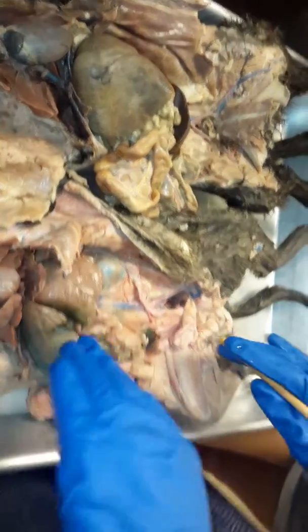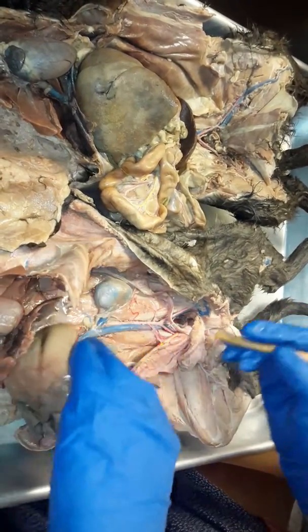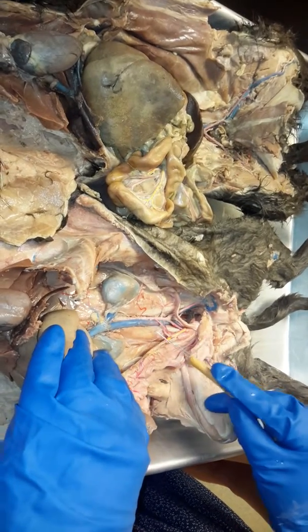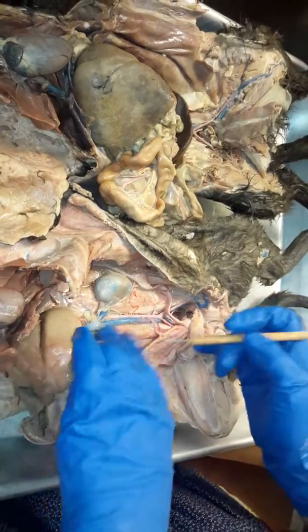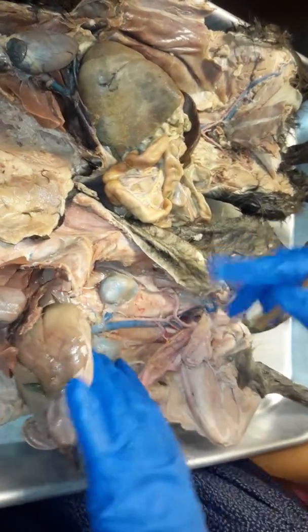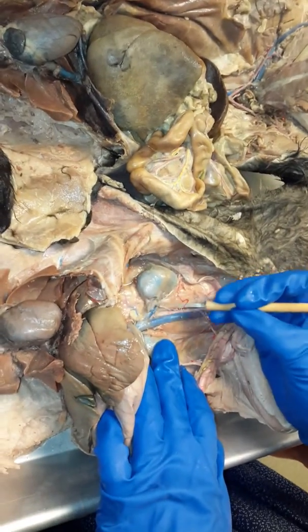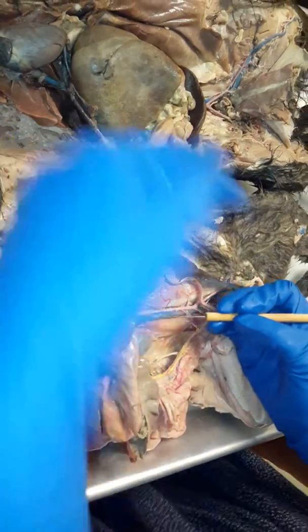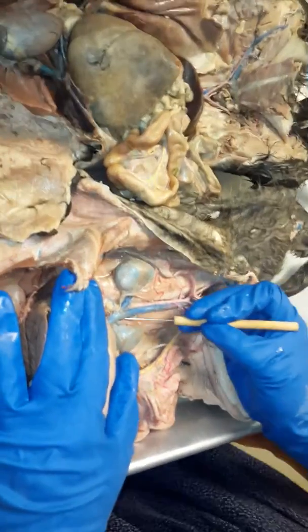Okay, so I'm going to use this cat because it shows the bottom ones a little bit better. All right, so the inferior vena cava is going to be parallel with the spinal cord. Right here, these two bean-shaped organs on the sides, those are the kidneys. Branching off and going to the kidney, this is going to be the left, because remember left, this is right. This will be the left renal vein, okay? And there's also a right one.